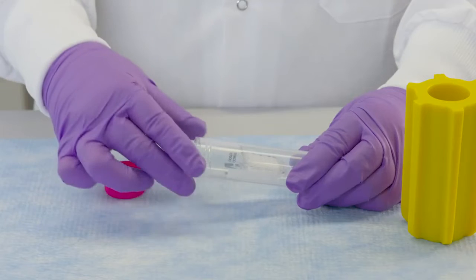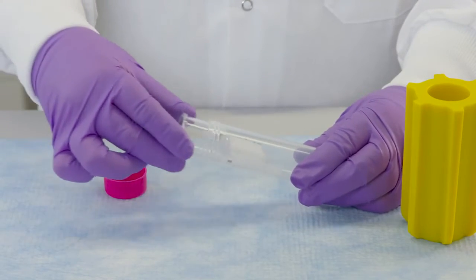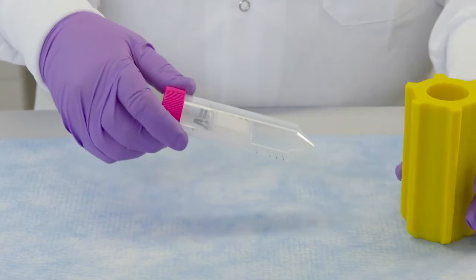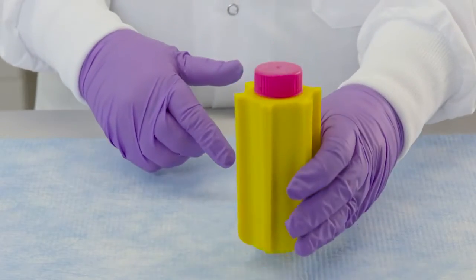Please note, with all Amicon Ultra filters, you'll want to orient the device in the centrifuge with the membrane panels facing up. The dual membrane panels are parallel to rotation when using a fixed angle rotor. This allows a more efficient configuration for device flow.